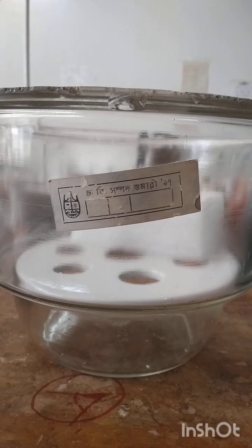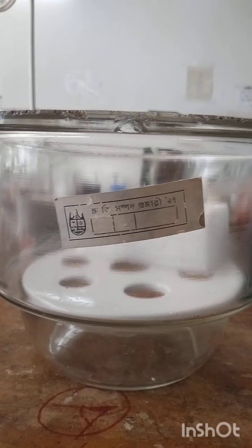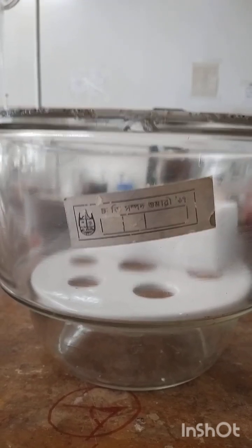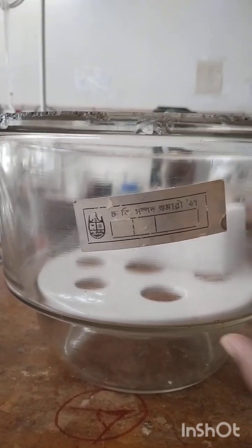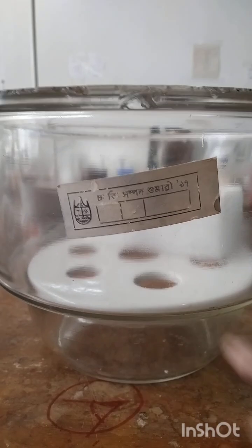And the next one is inserting the sample. Cool hot samples. When our sample is hot, it should not be transferred directly. That means you should first bring your sample to room temperature, and place the sample on the ceramic or glass plate. And you have to keep in mind that your sample should be kept in this specific upper disc, and then seal the lid.